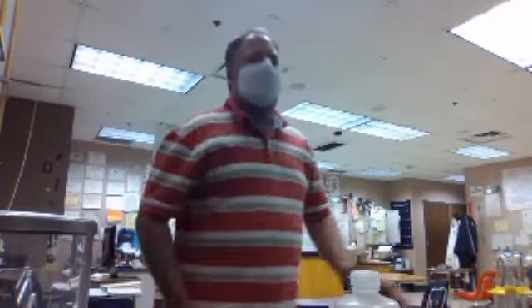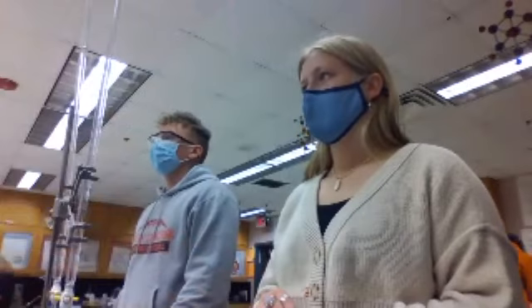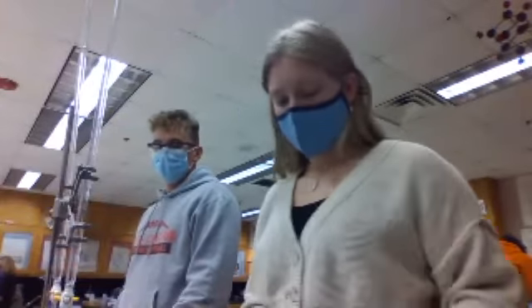All right, cool. So right around 7, you want to start slowing down. Now you have to determine whether you're taking the pH for every 1 milliliter or not, and tell them to make sure they write down the pH. You can do it tomorrow or the next trial. Okay, then I'm not gonna do it this time. All right, so we just need to add that slowly until it turns blue.